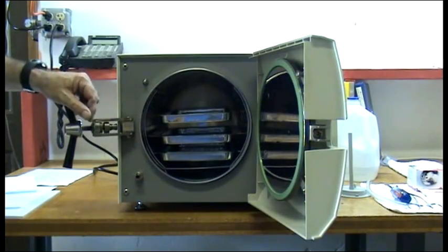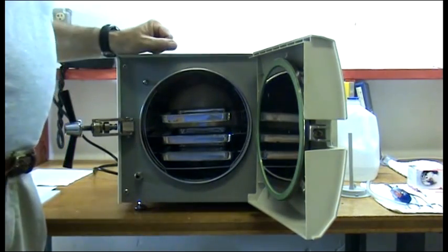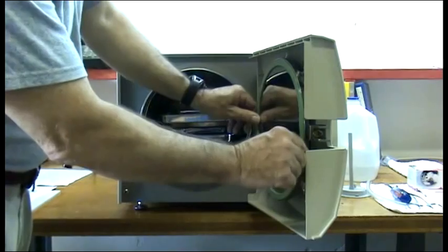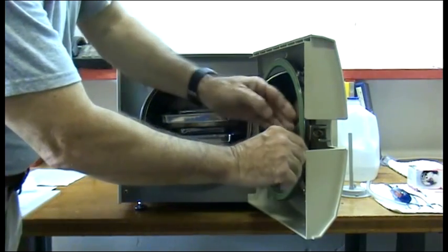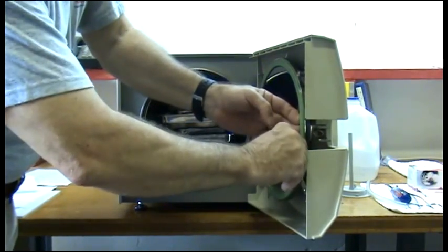Approximately yearly, or at signs of wear, it's time to change your door gasket. The easiest way to do this is to pull out the old gasket.